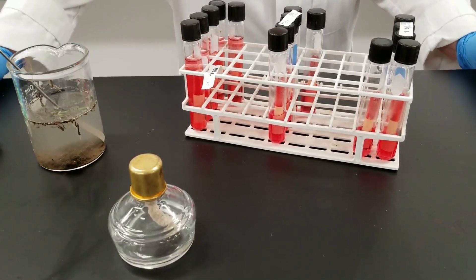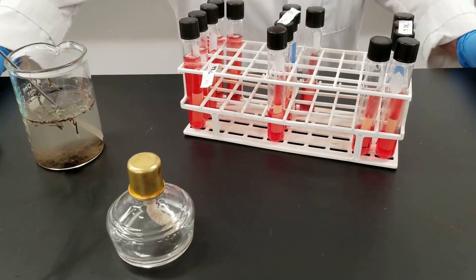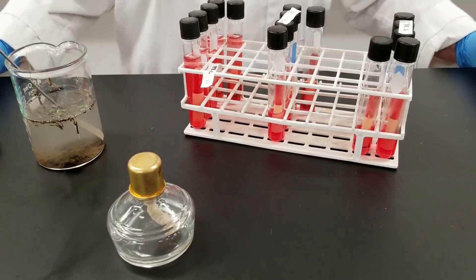There's a filtration method. Another method is called the MPN, the most probable number, and that's what we have set up here.